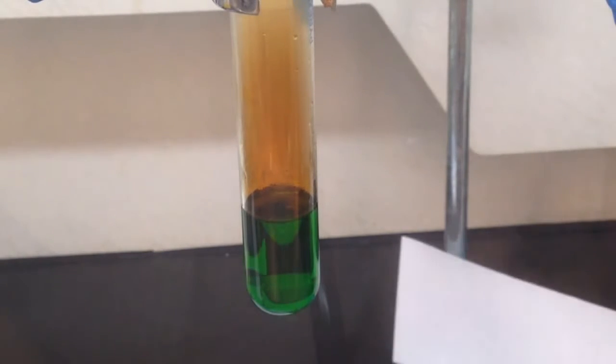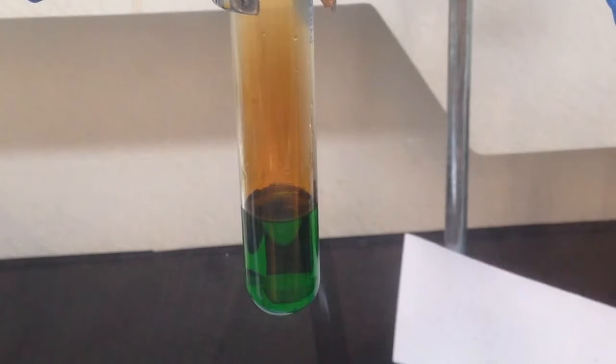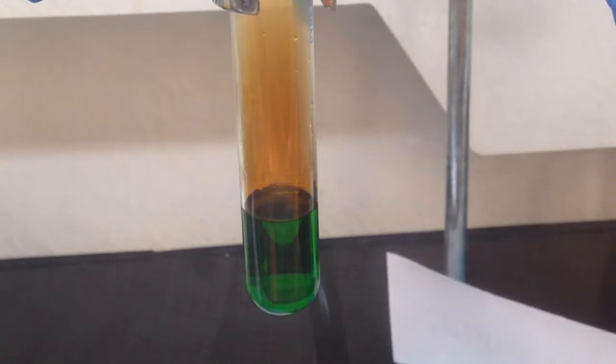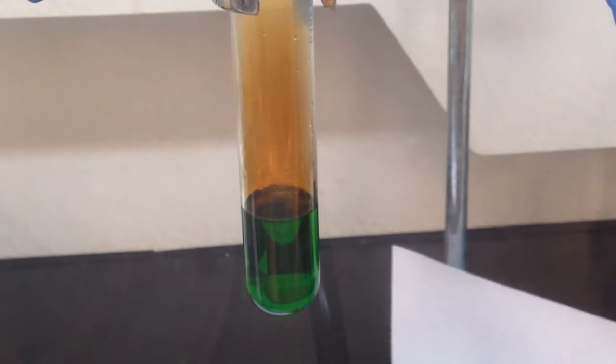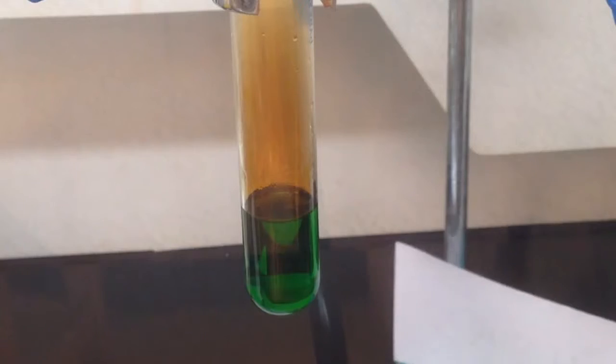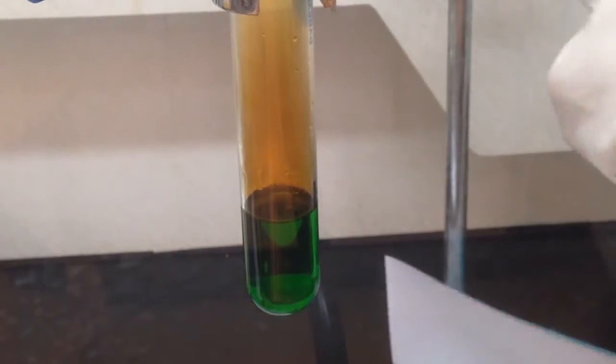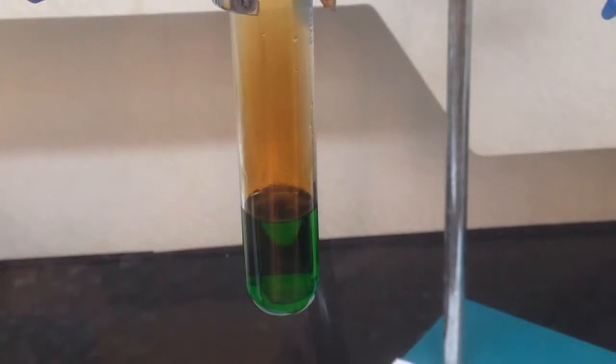And you notice there's some brown gas that appeared right above the surface. That one is nitrogen dioxide. Nitrogen dioxide is extremely toxic and highly water soluble. So we know nitrogen dioxide is one of the pollutant gases in the air. And how can we obtain a very traditional blue color of copper 2 ion?